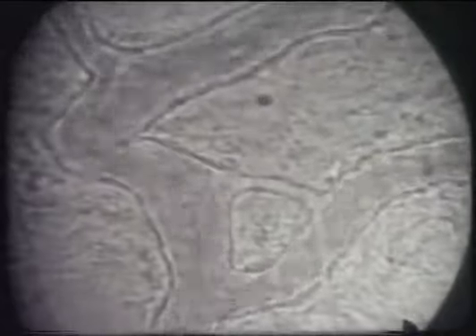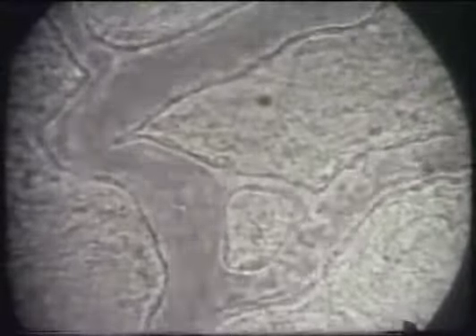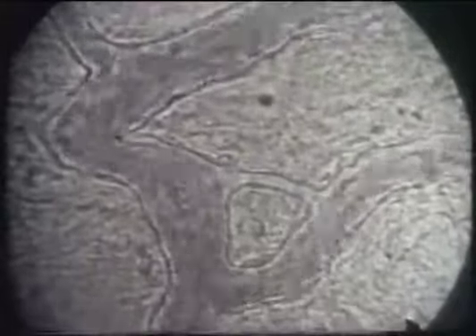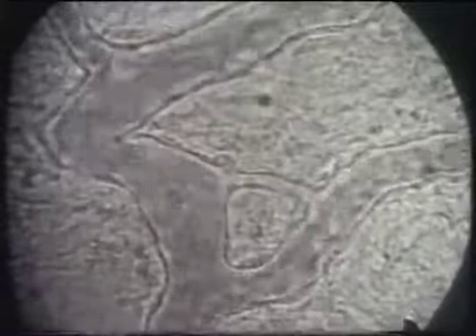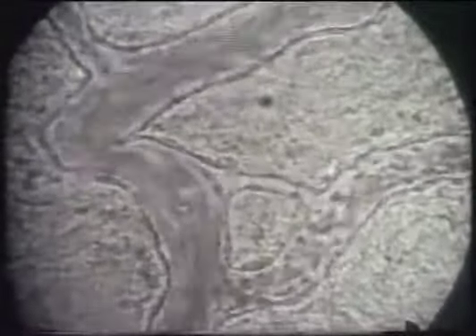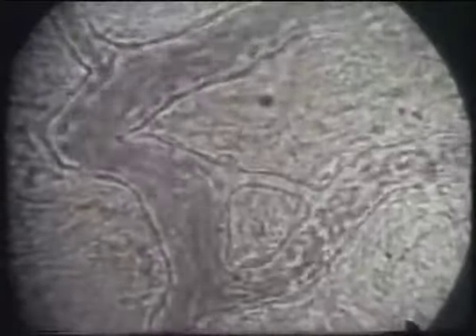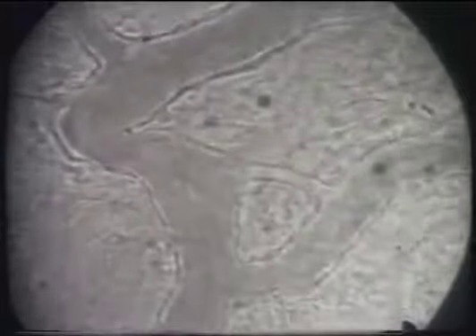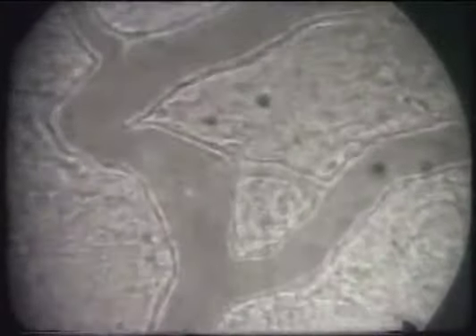Most of these early films had graphic as well as textual material included in them, telling you what is coming in the subsequent scenes. And that's the case with this one. Now as the temperature approaches 97 degrees, or body temperature, the flow is quite rapid and back to essentially normal conditions.